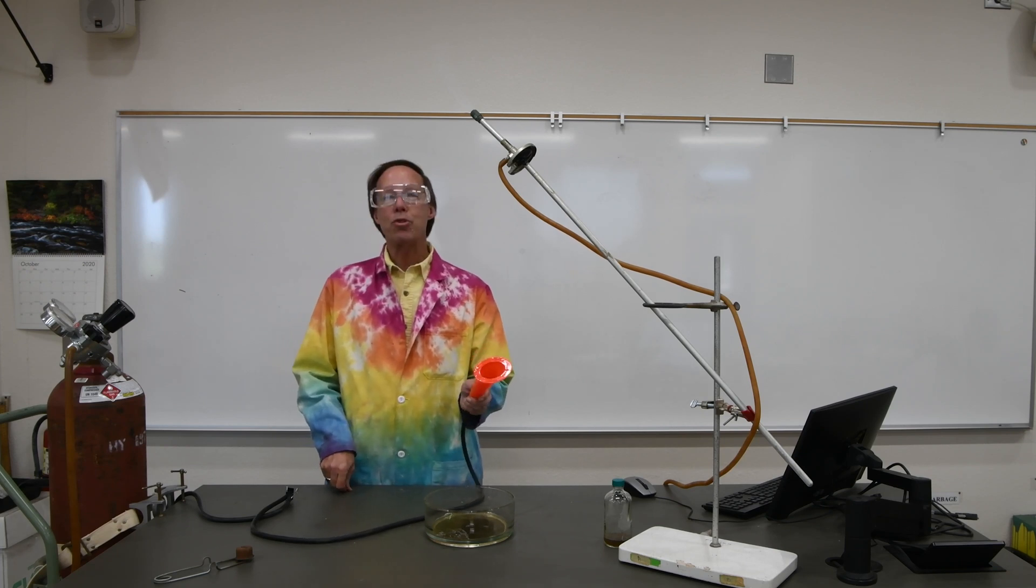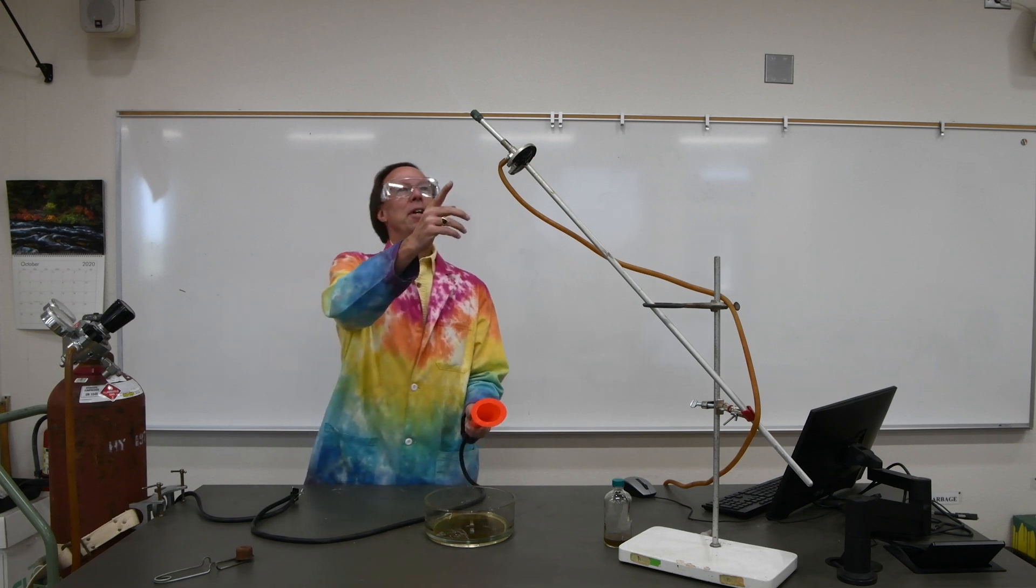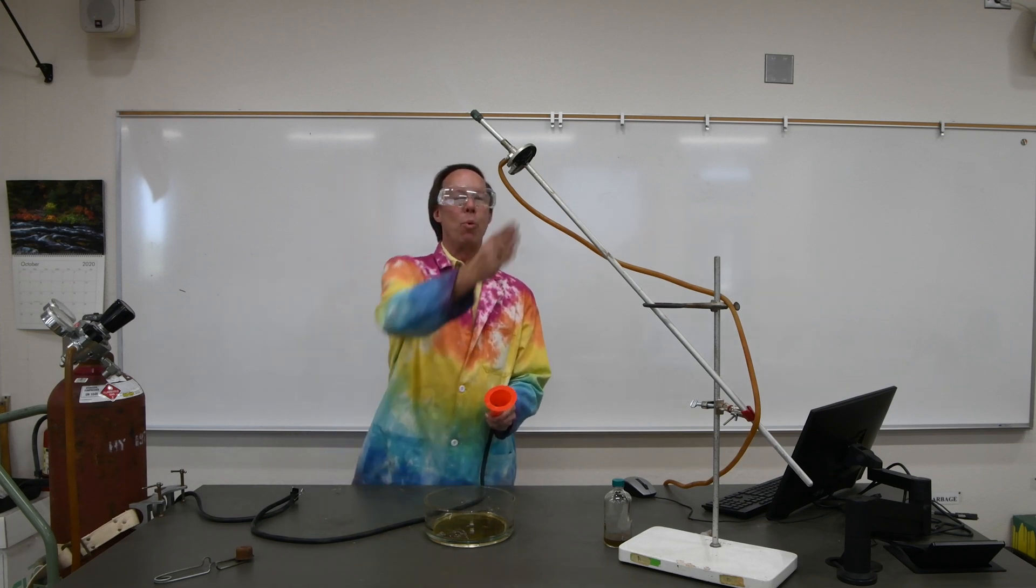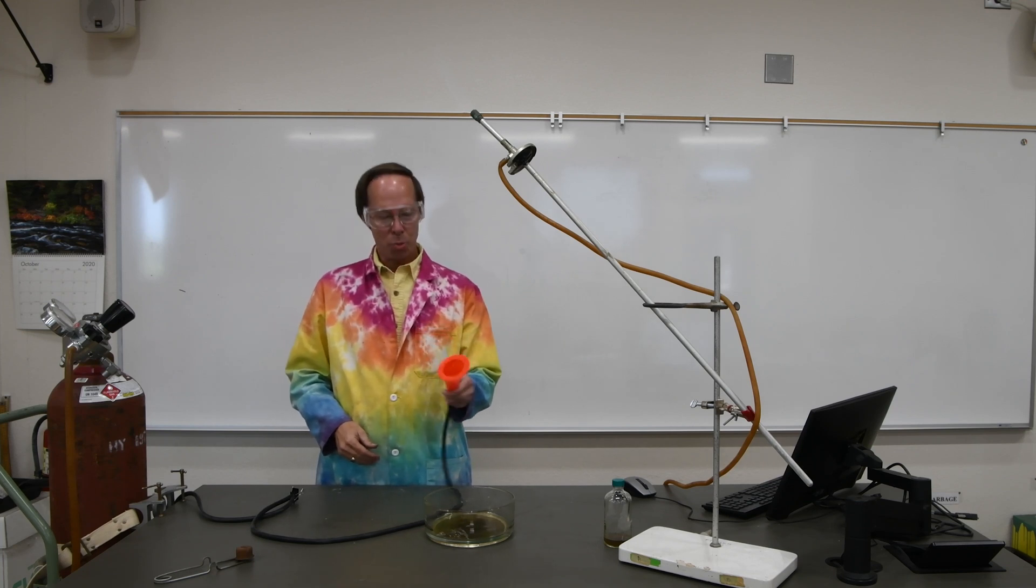Another fun demonstration I like to do is to fill soap bubbles with methane. Now above it I have a torch, so there's a Bunsen burner welded on the end of this pole and we're going to have some extra fun here.